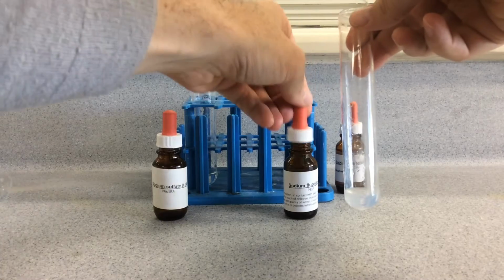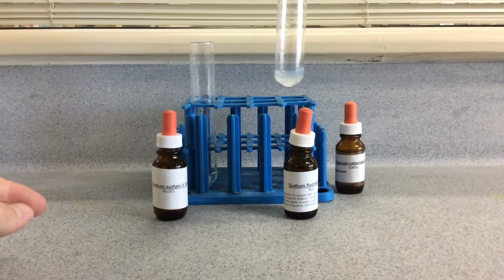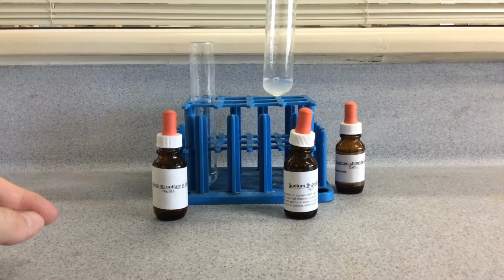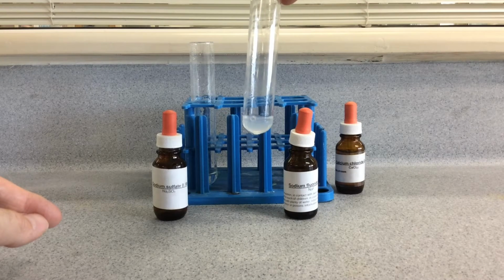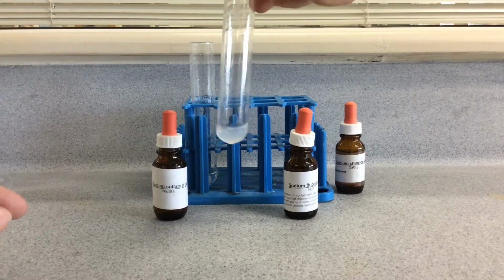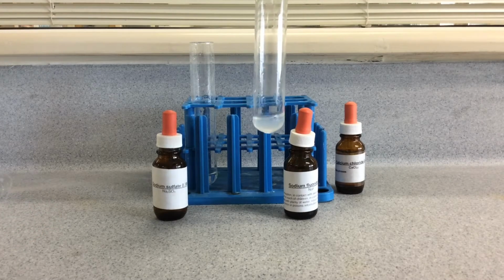And you do have a third test that you can use to distinguish barium and calcium, which is the flame test. So calcium produces a brick red colour, whereas the barium produces a pale green flame colour. So that's a good way to distinguish between the two.